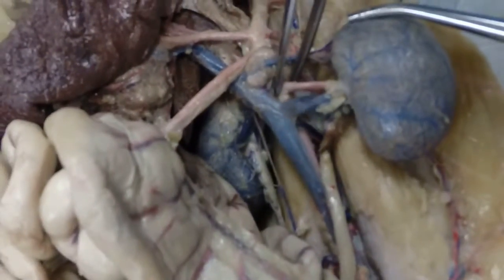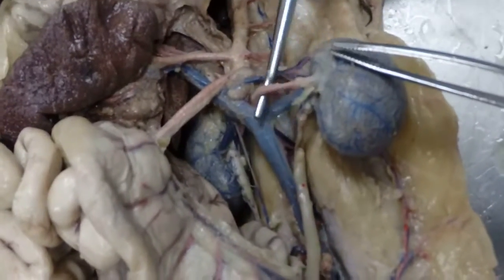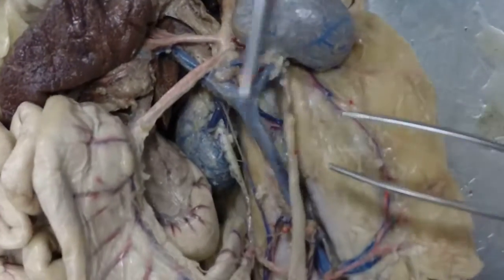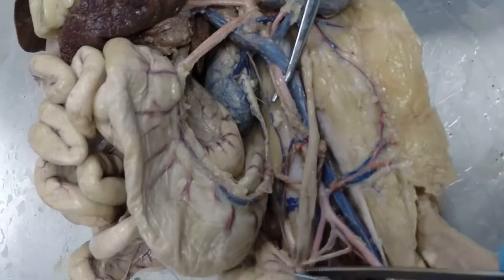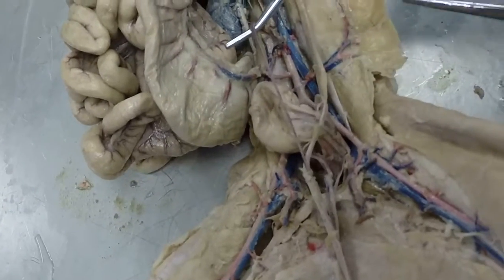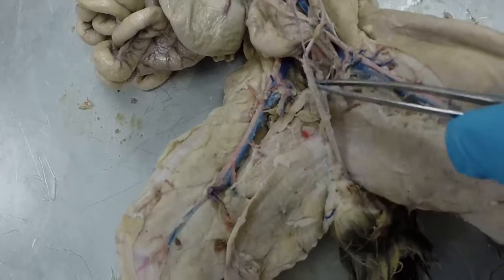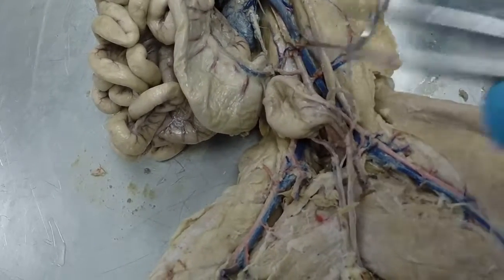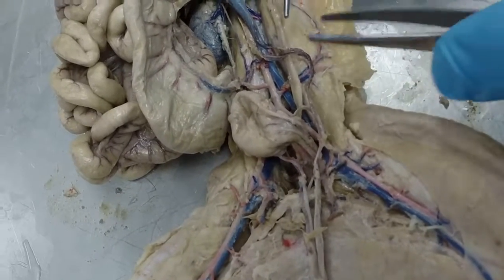Back on the descending abdominal aorta, our next branch is this one right here, which is the renal artery. This would be a left renal artery. And then we're back on the descending abdominal aorta, and our next branch is this very delicate artery right here that I've taken a lot of care to preserve. This is our gonadal artery, and this is a male cat, so it's going all the way down into the spermatic cords and then down to the testes. This is our left gonadal artery on the male. If this was a female, this delicate artery would go straight across to the ovary.